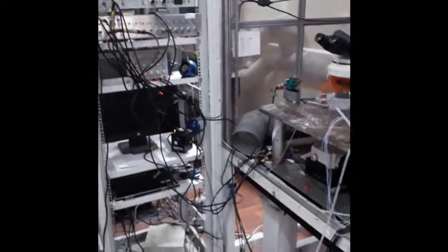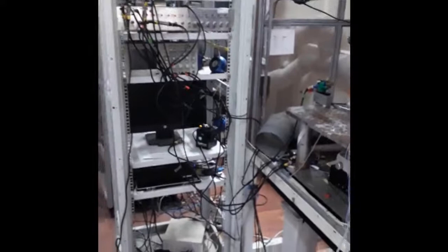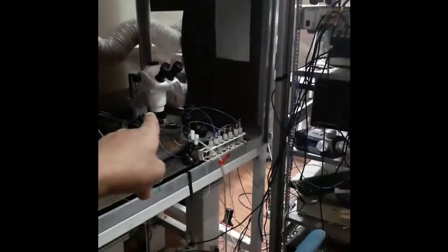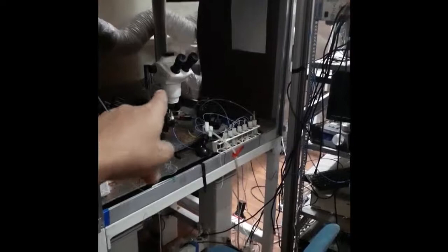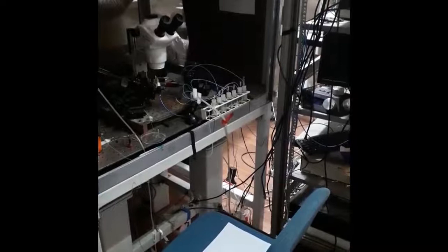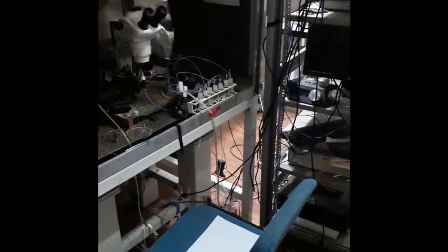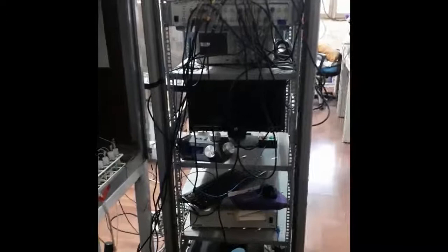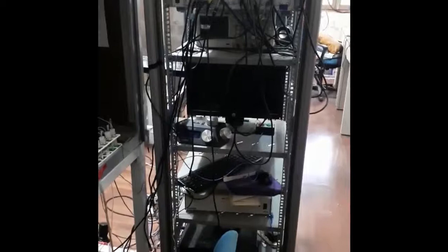Now, before explaining the different components on this rig, I will also show you a slightly different kind of rig that we use in our lab. This rig has basically similar things as before, but you will notice it has a stereo zoom microscope instead of a compound microscope. That has its own reason — when you want to do a particular kind of recording or visualize the brain in a certain way while recording, it is preferable to use a stereo zoom microscope in certain scenarios. Basically, the components on this rack are very similar and we will go through each of them.